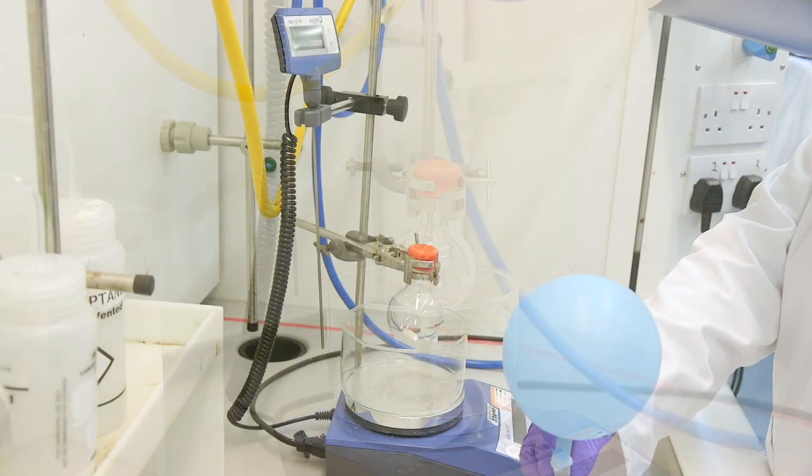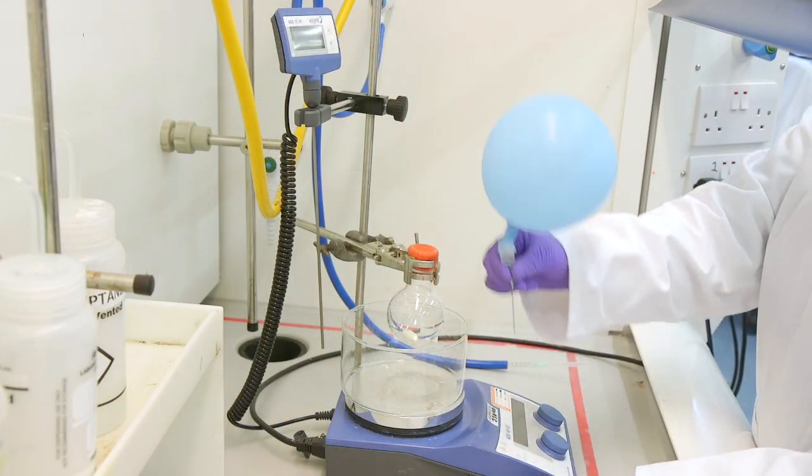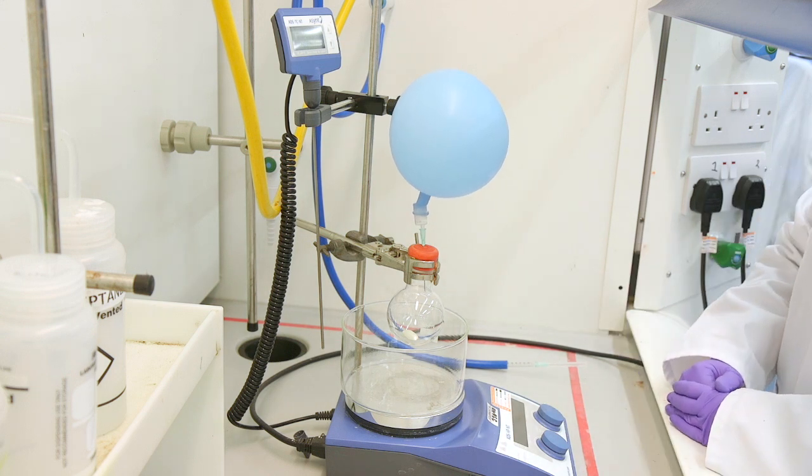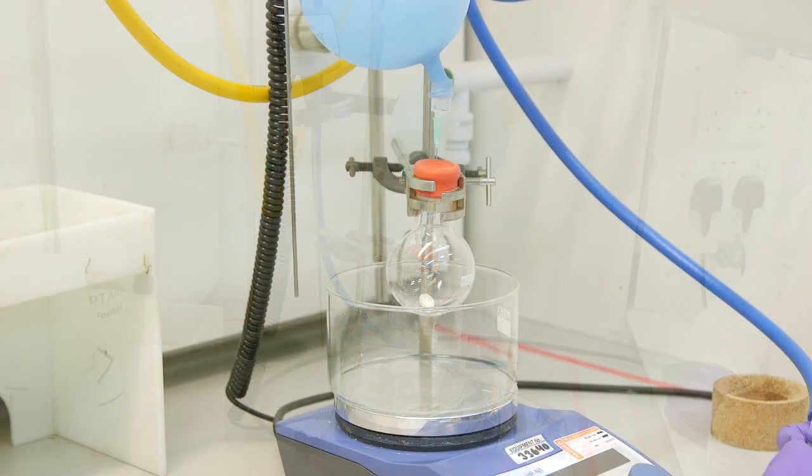Next we are going to add our nitrogen balloon to the top of the flask. This will allow the nitrogen gas to flow into the flask. However, the atmosphere inside of the flask is not inert as it still contains air that was present prior to sealing the flask.